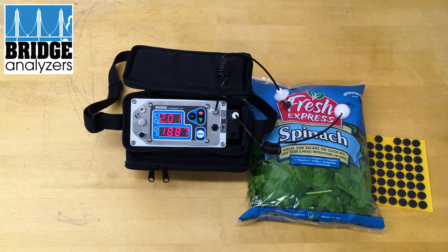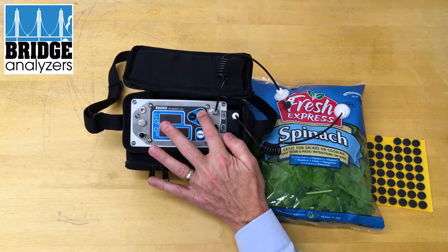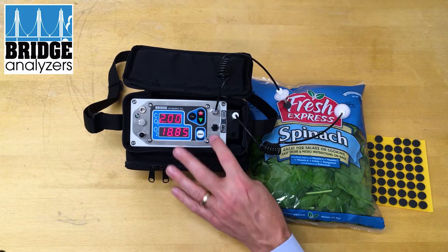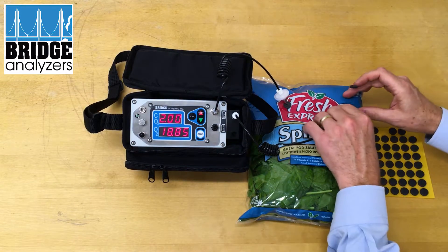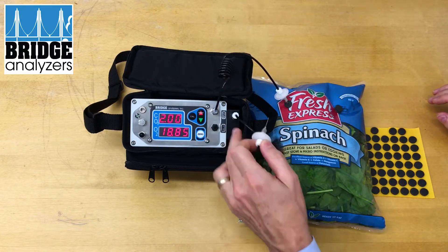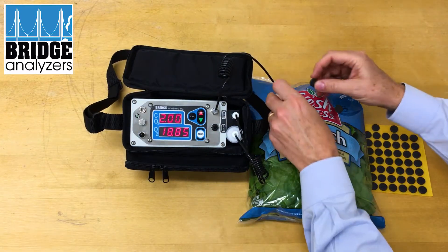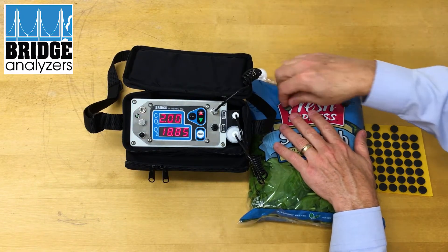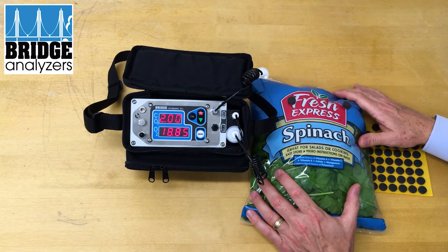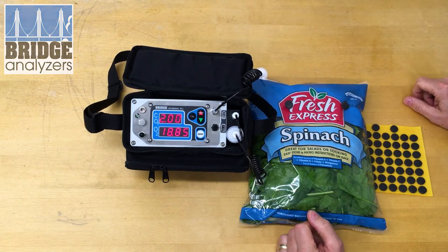You can get your readings and then if I hit the test button I would do a discrete test. Here's our normal operation where it blinks for 15 seconds and then the pump turns off. I can take a second septum and pull it and apply the septum over the top, and I'll do the same on the exhaust. That's not going to be a perfect seal but it will be sealed to some extent — sealed to keep air from the outside from going in.